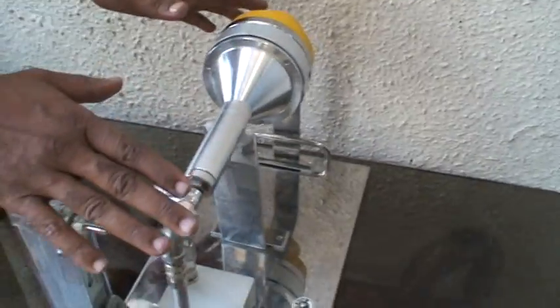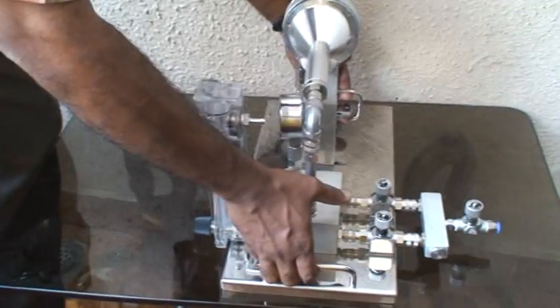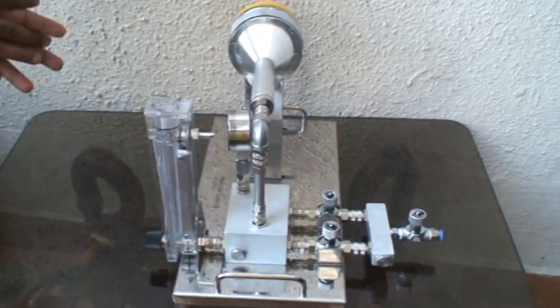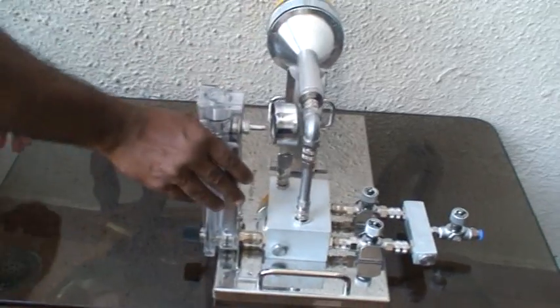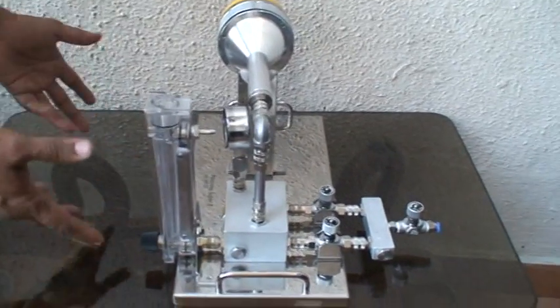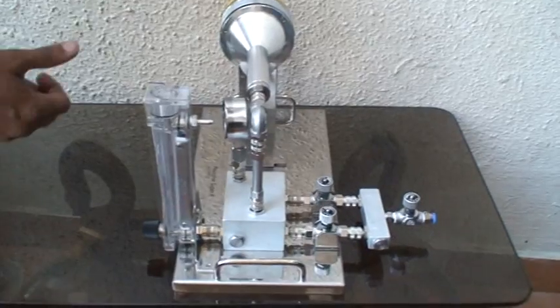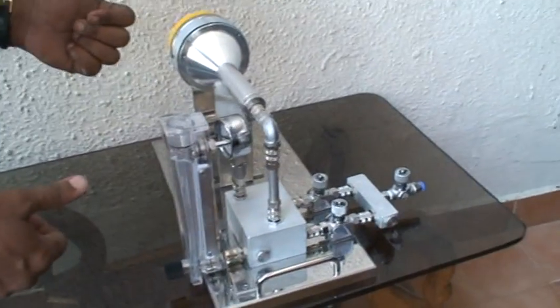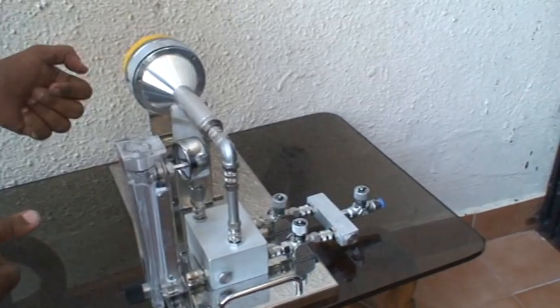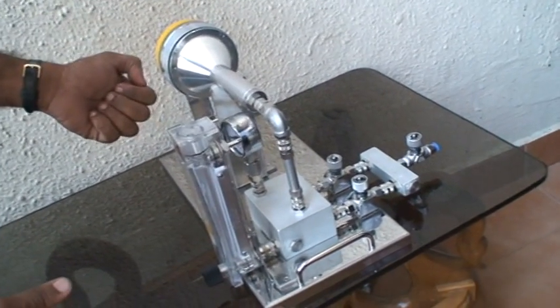This is a very simple, portable system which you can carry from one place to another. Except for the pressure gauge and the rotameter, all parts are sterilizable or auto-clavable. You just switch on your timer — watch for 5 minutes or 10 minutes — because at 100 liters per minute, 10 minutes will cover 1000 liters of volume.